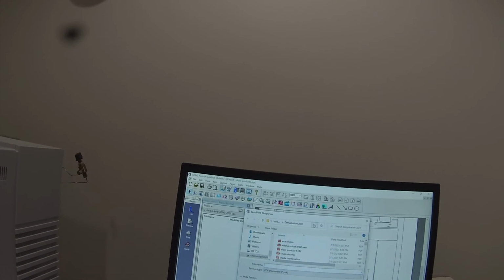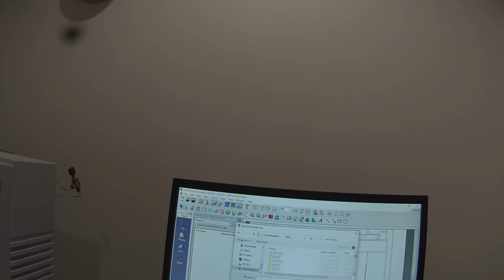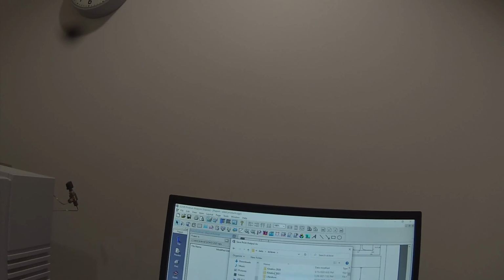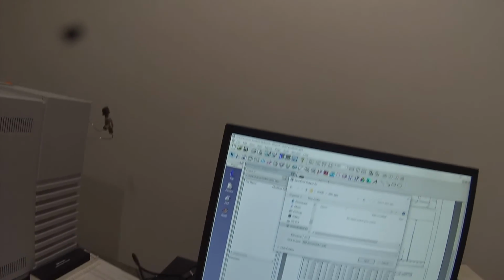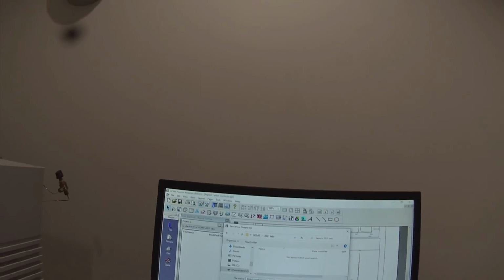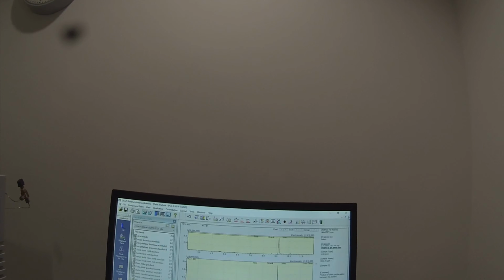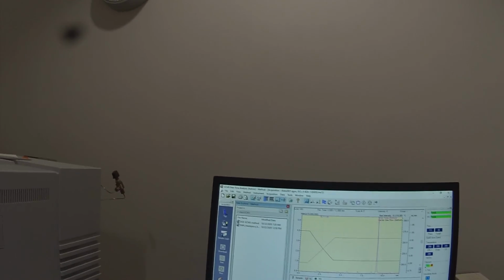And I think I'm already pointing. Nope, I'm not pointing where I want to point. I'm going to go to J, data. I've got a GCMS folder. And in there I've got 2021 labs. This is going to be Aldol condensation K2B4. And I'll have that uploaded. Decent GCMS spec result. Close that. Close that and put this back to JData GCMS, and that's it for the data for today.